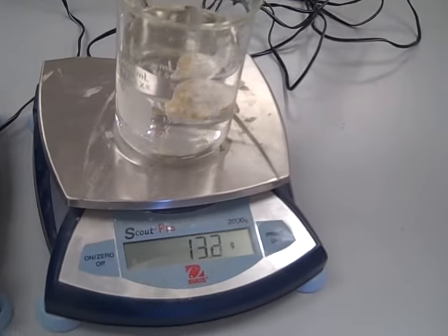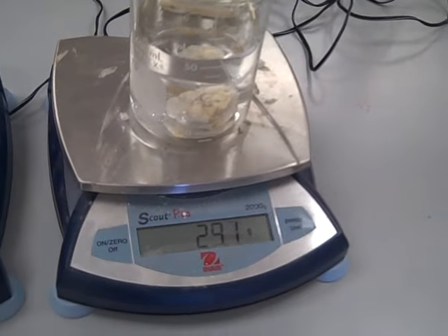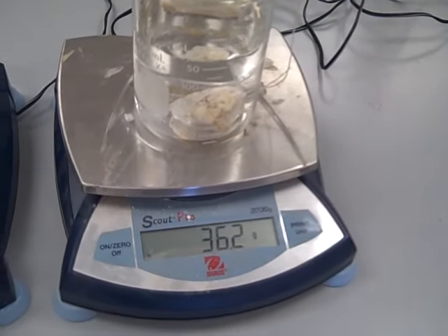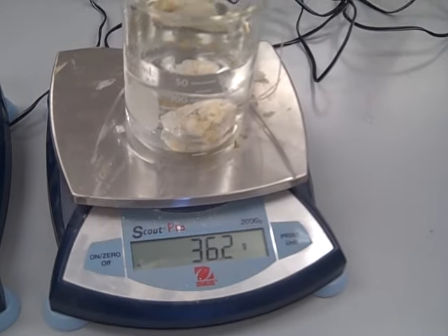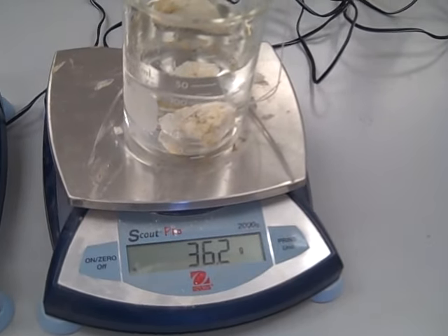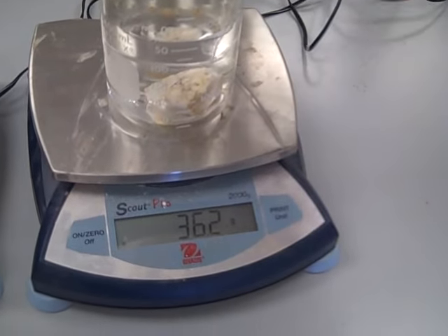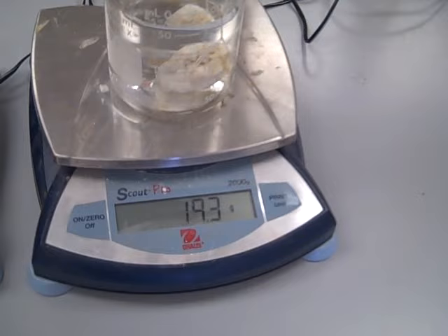Now I want you to see what happens if I allow the rock to settle on the bottom of the container instead of just being immersed in the water and suspended. If I put it on the bottom of the beaker, the mass reads 36.2, which is the mass of the rock.